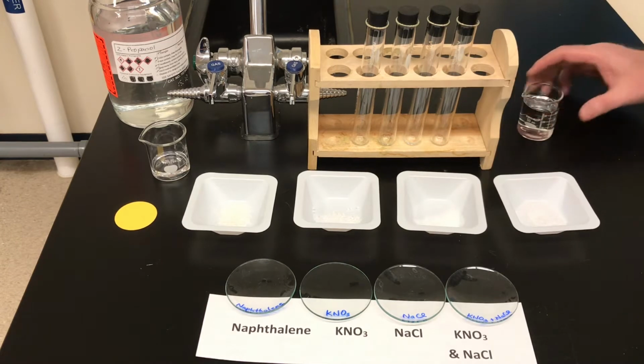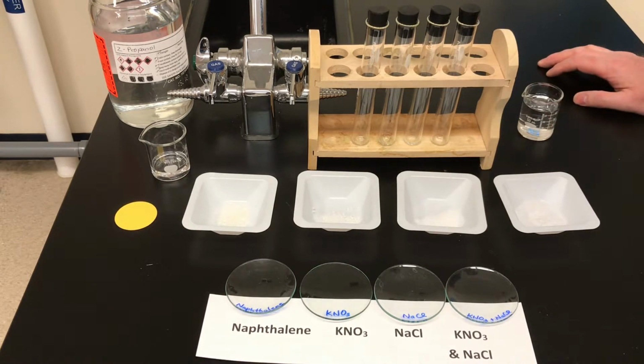Okay, so based on our alcohol as a solvent lab, you should have found that naphthalene along with BHT are soluble in an alcohol. So for naphthalene, we are going to dissolve it in 2-propanol. And it doesn't matter which alcohol. In that lab that we had done with alcohol as a solvent, we also used methanol as a solvent. So if you had some methanol, you could also use that, right?